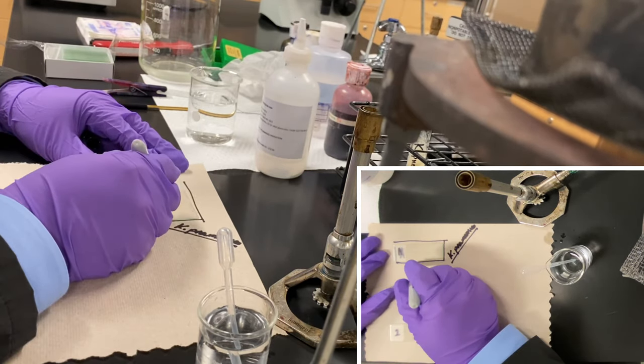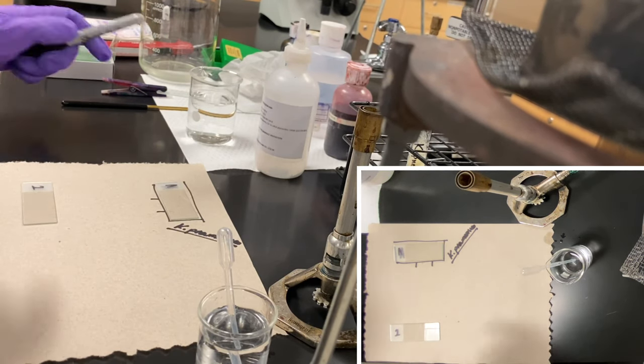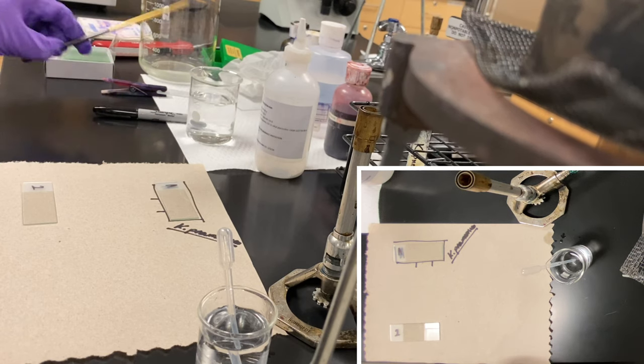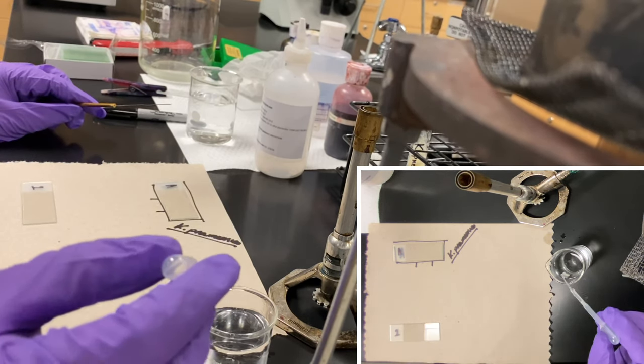I'm even going to point out where I'm going to create my dual smear. I'm going to leave this one for later. So I'm going to take my loops to transfer material. I'm actually going to create my tiny little drops in this case.